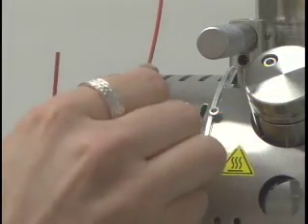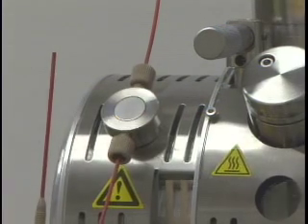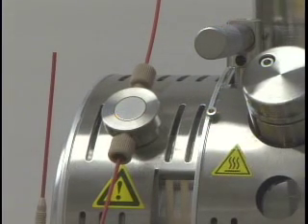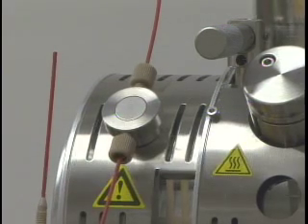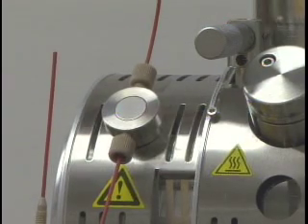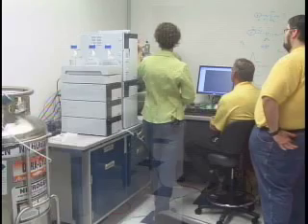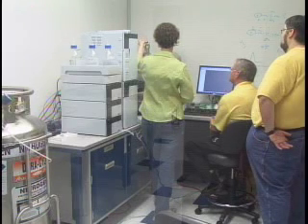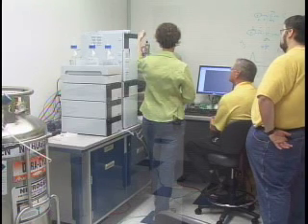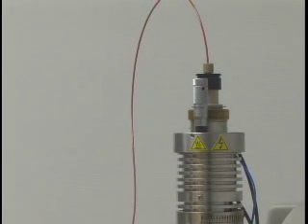When you're optimizing your instrument, you want to make sure you optimize the source housing components. That includes the position of your probe — you can change the position of the electrode inside the probe, and you can change the position of the probe itself with these micrometers. You can adjust the actual up-and-down position of the probe as well.